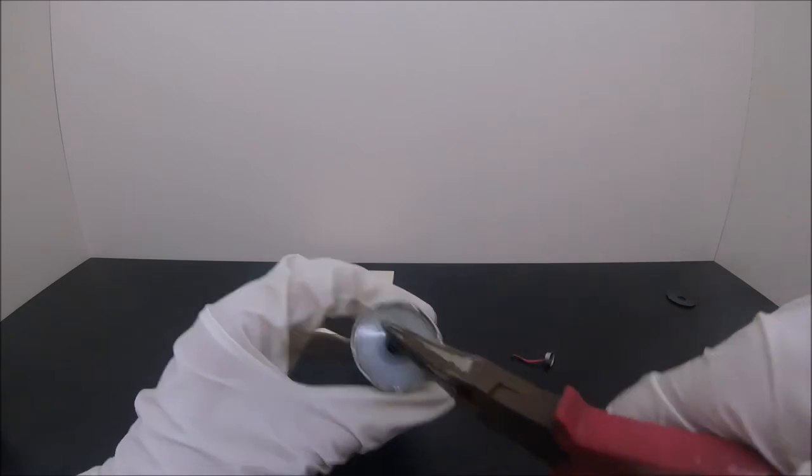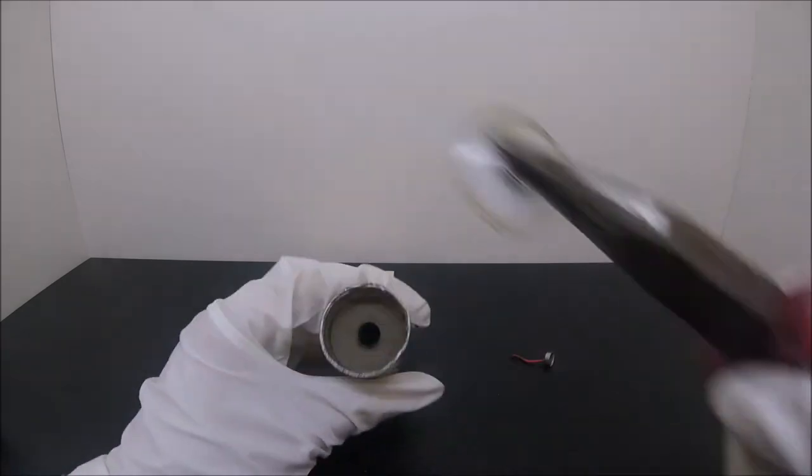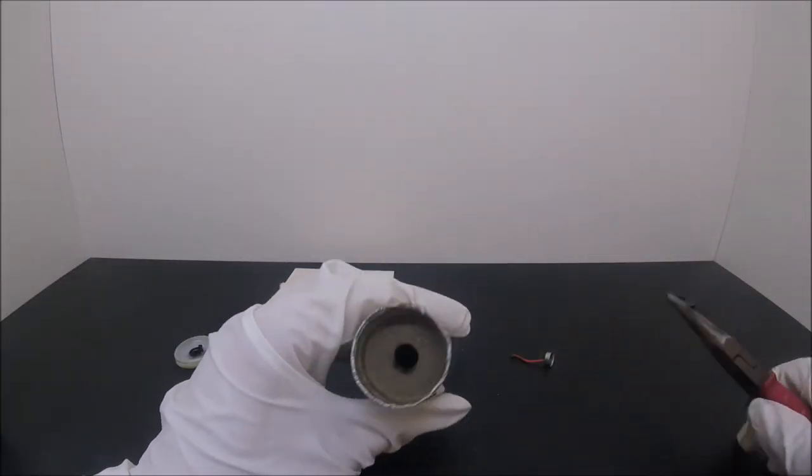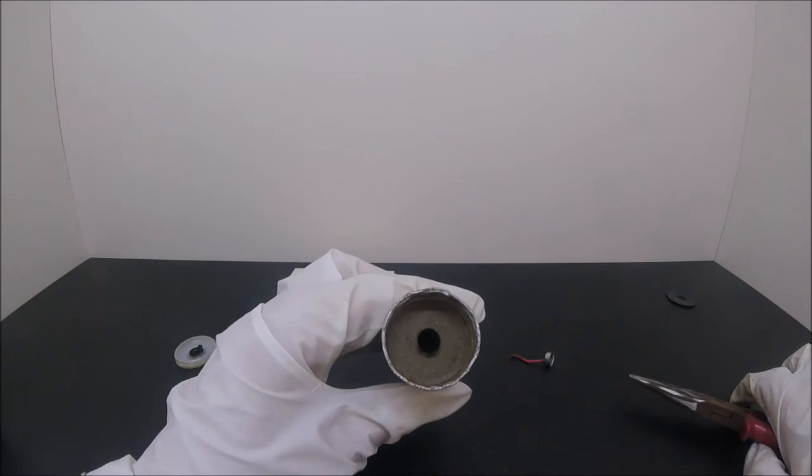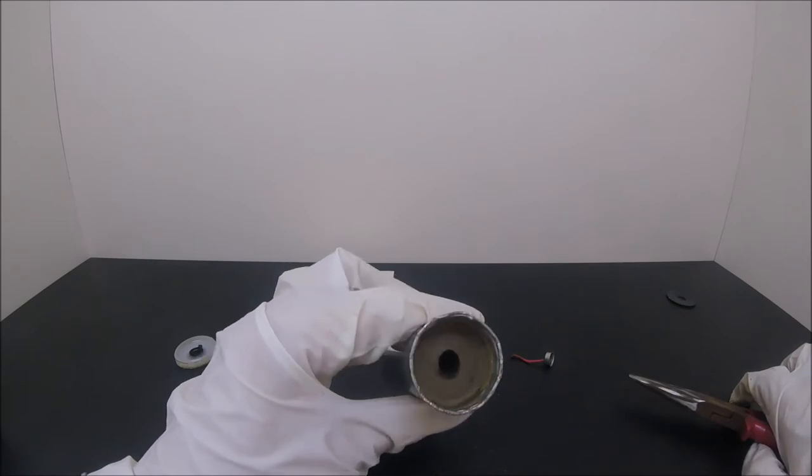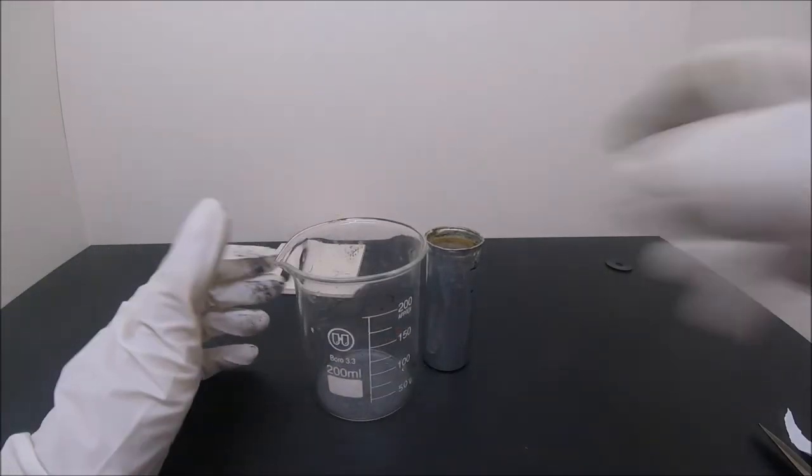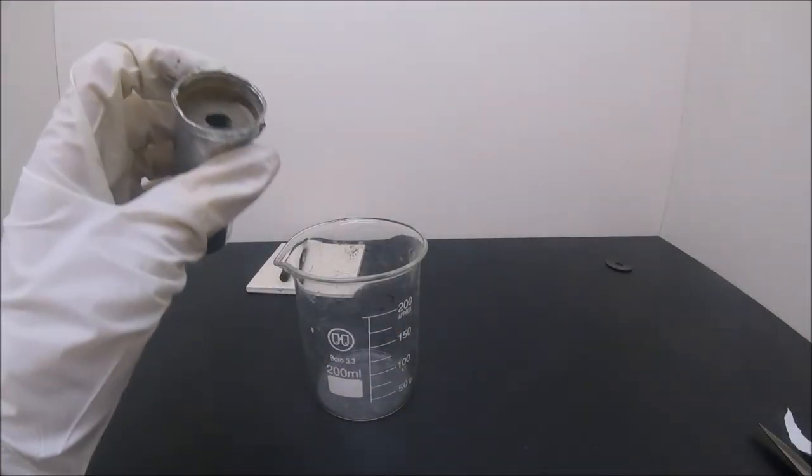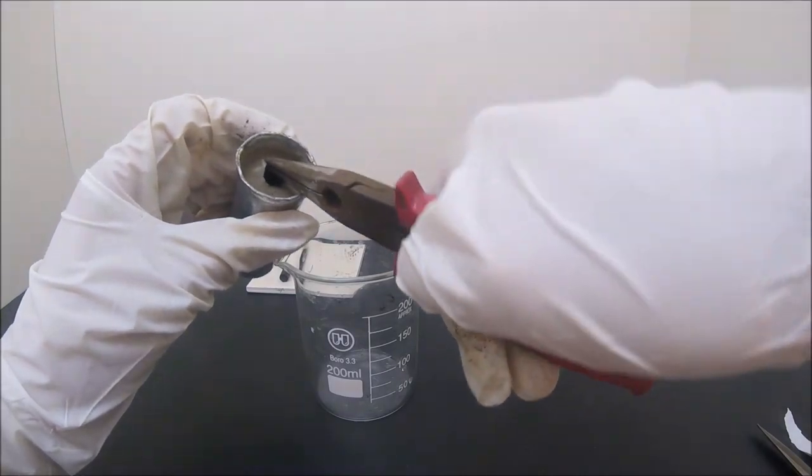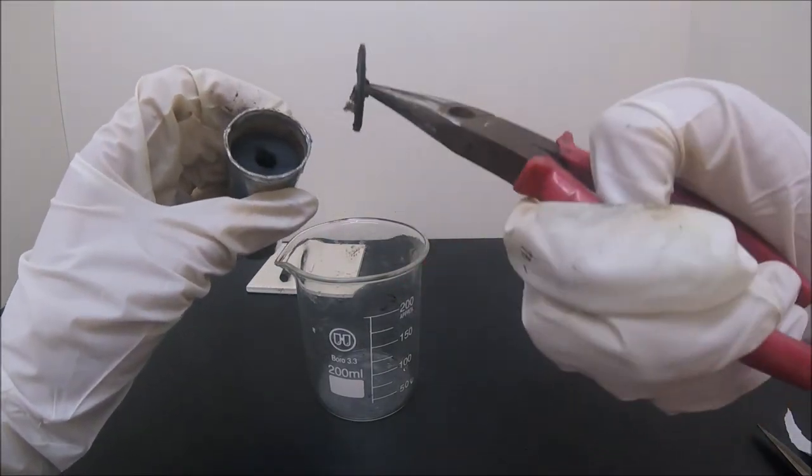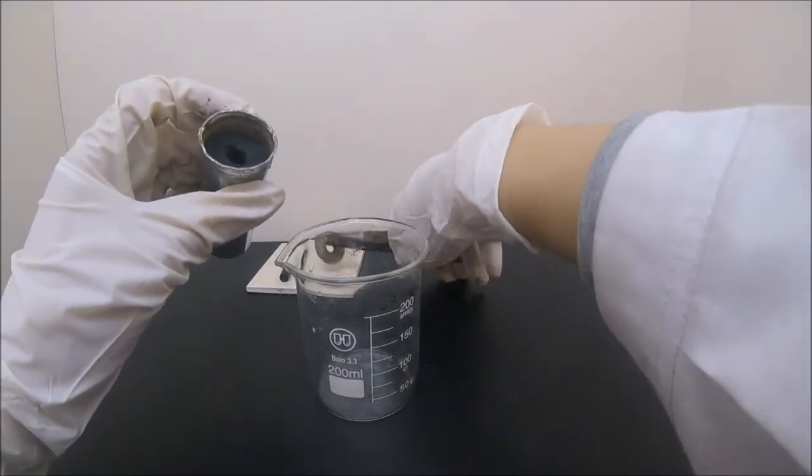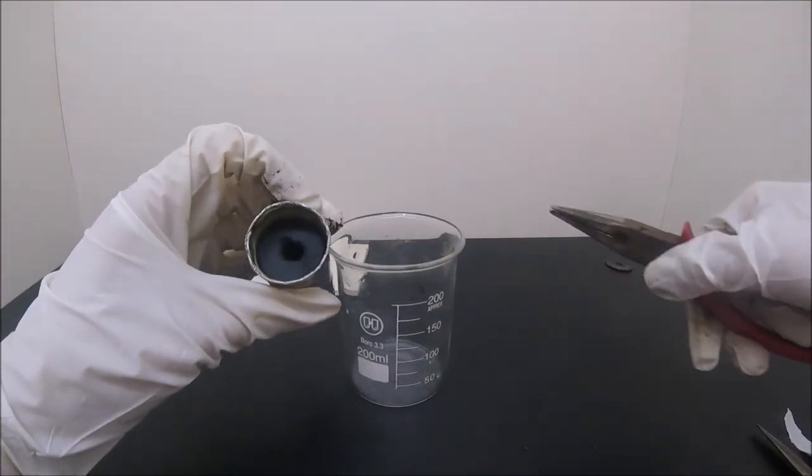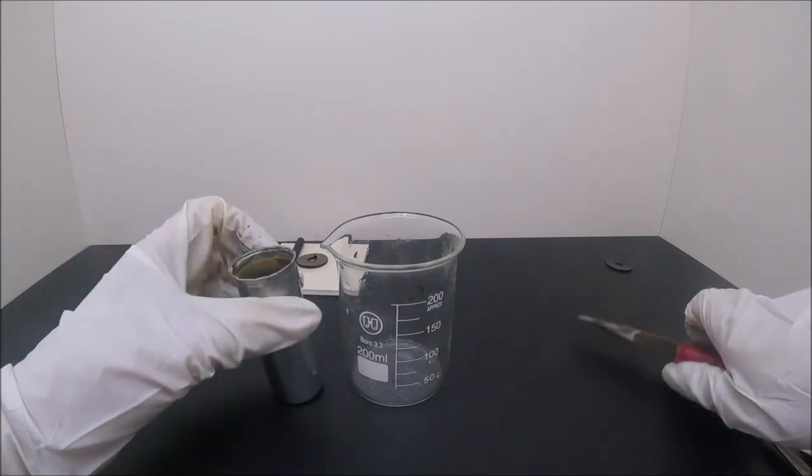The surface is coated with some organic material. If you want to use it in electrochemistry, be sure to wash them with hot water. Now comes the fun part. After removing the piece of cardboard, we can finally see the manganese dioxide that we have all been waiting for.